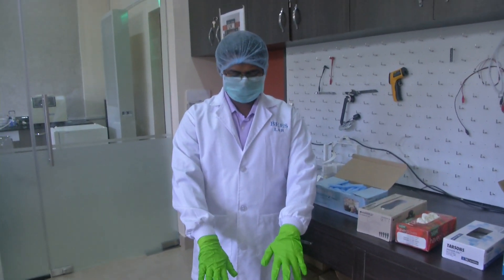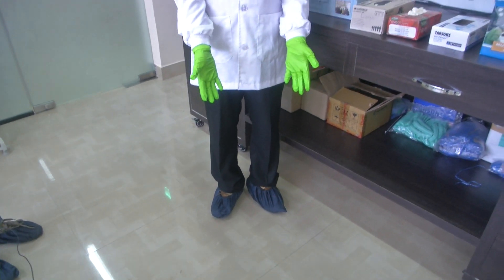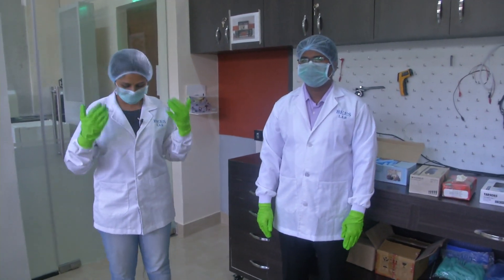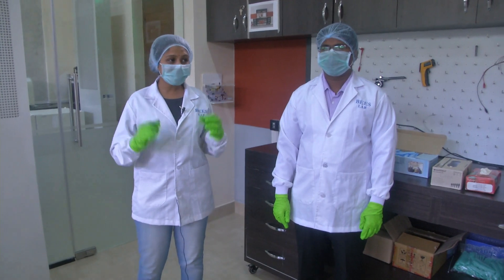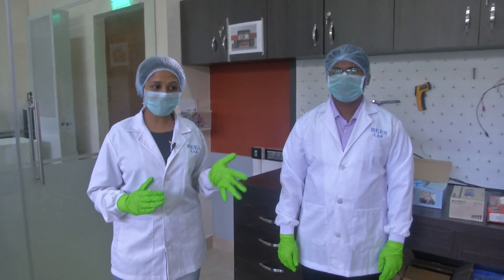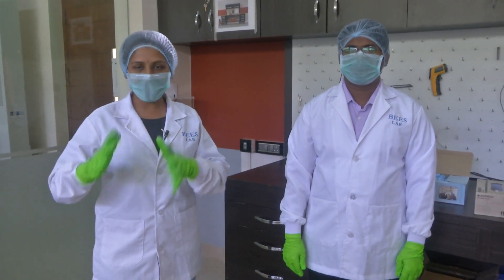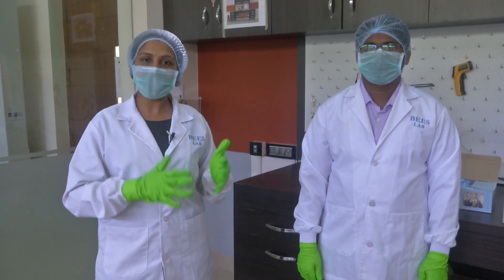This was the entire gowning procedure the visiting scholar followed to use the clean room facility. The sequence of following the gowning procedure is very important. Here we have a class 10,000 clean room — the particulate count is constrained to certain numbers, and you can study more about how the ISO standard classifies clean rooms worldwide based on ISO standards.